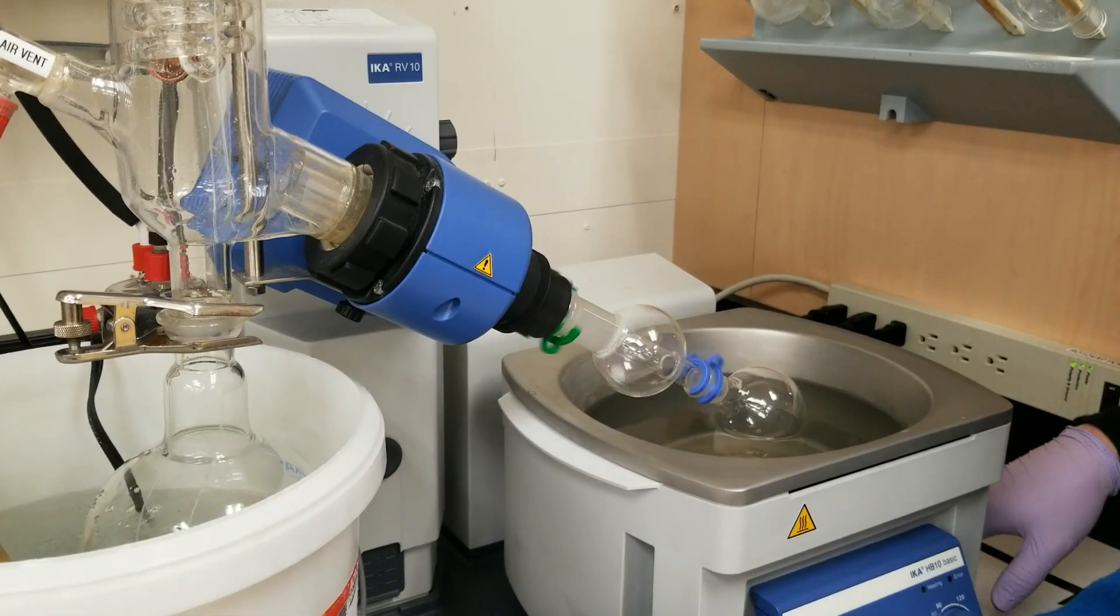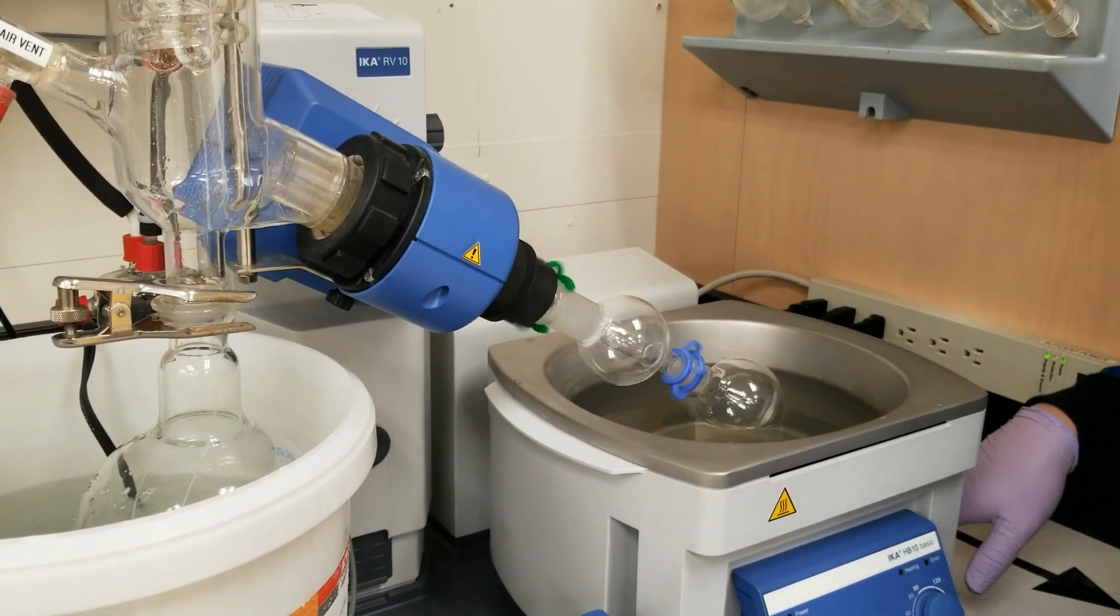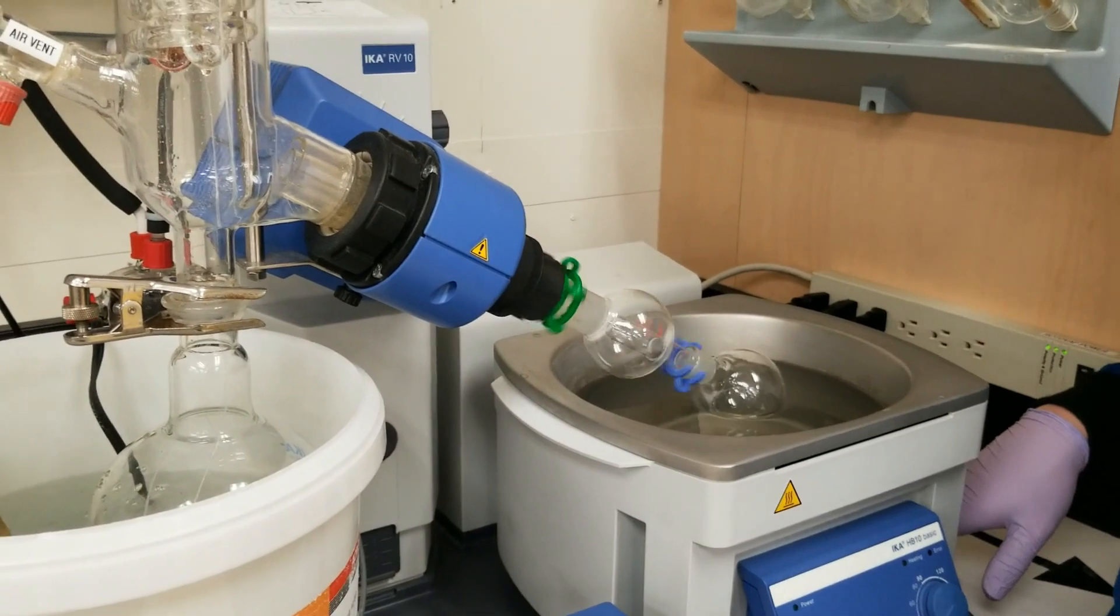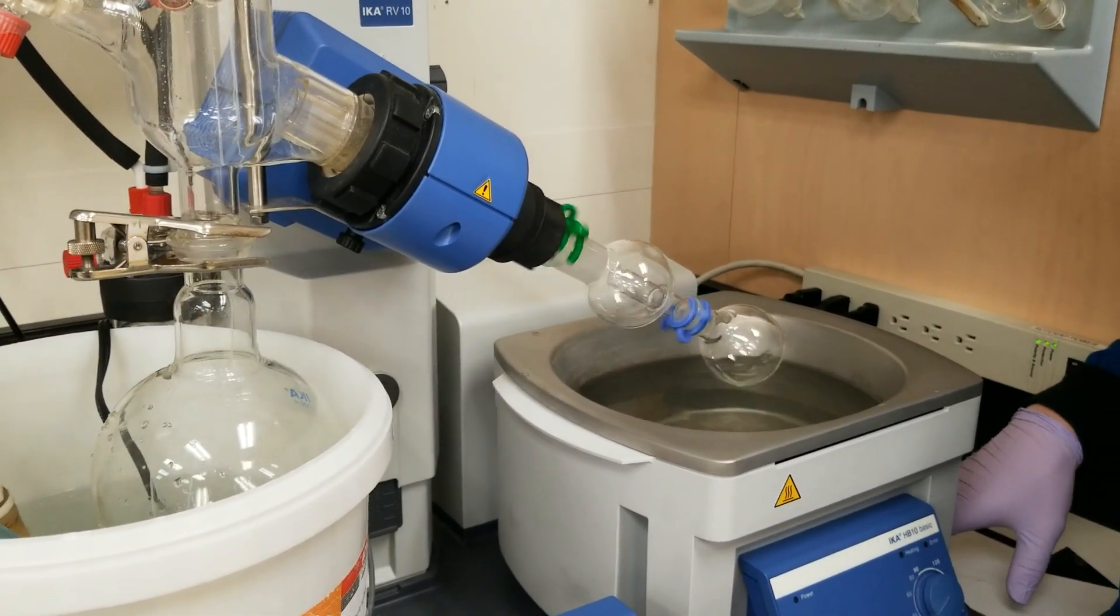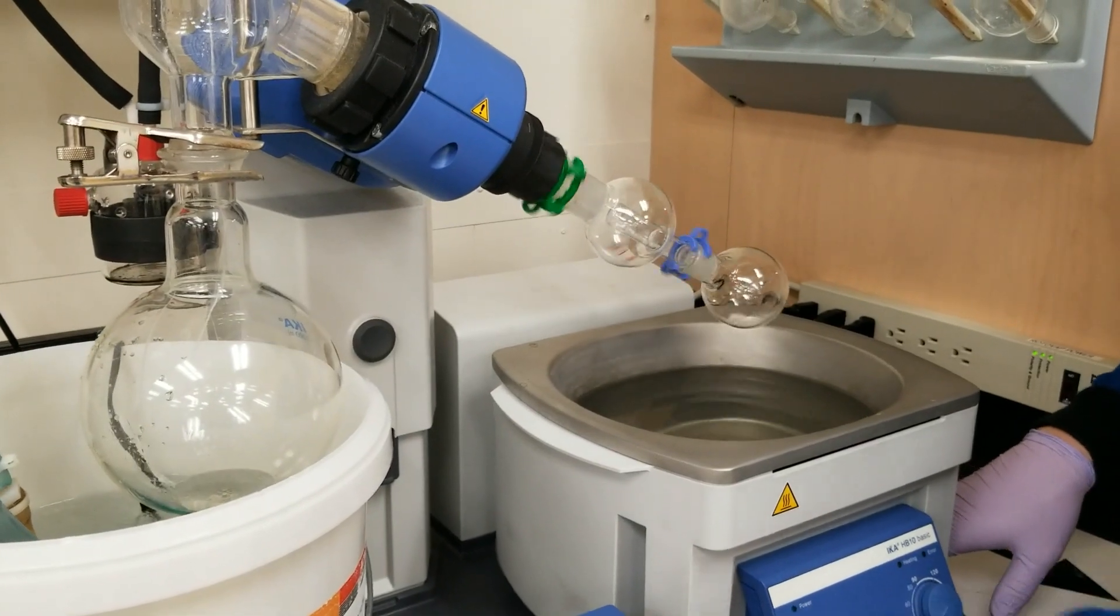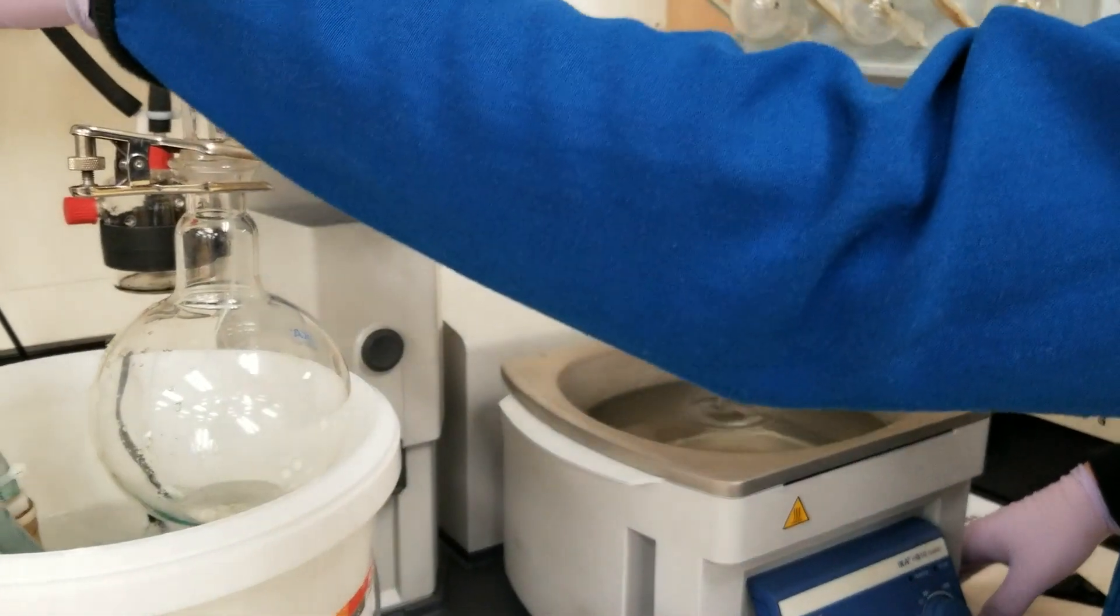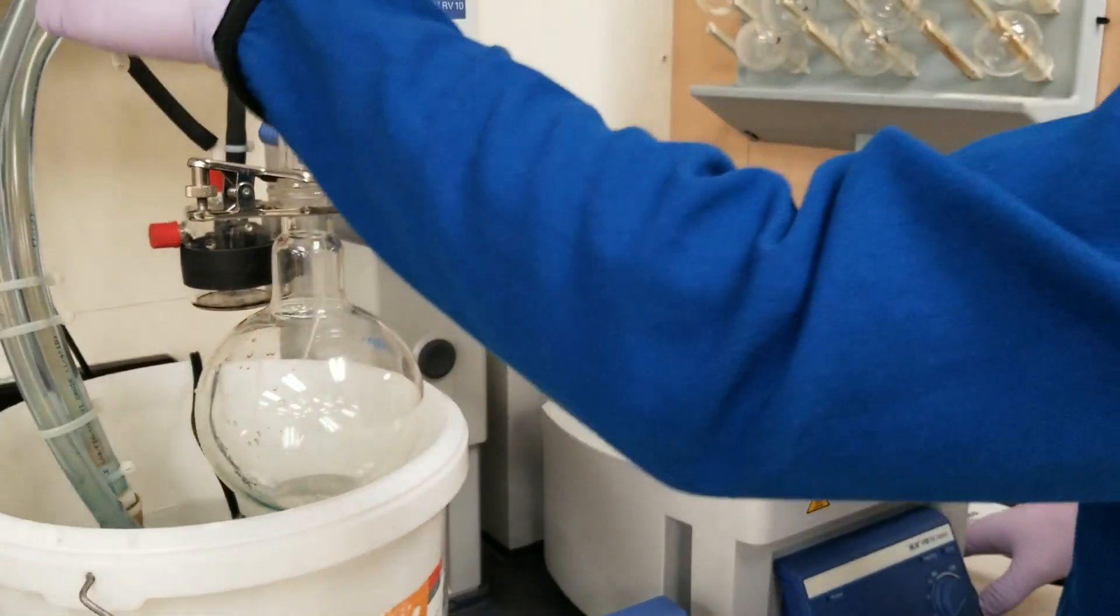Oh wait, I forgot, sorry to mess with you guys. This is an oil. This product that we're collecting is an oil, so I just freaked myself out. It's not going to solidify on the sides because it's an oil at room temperature. So let's kill this and see what kind of tiny droplet of oil we have collected here.